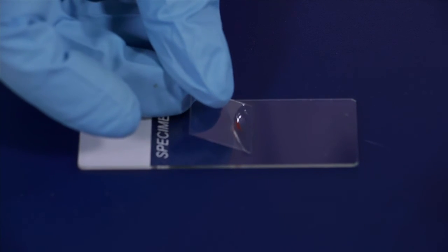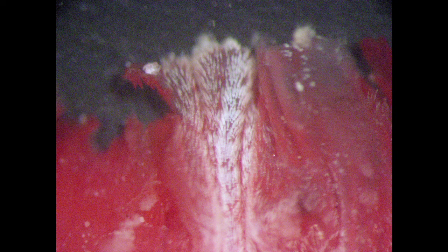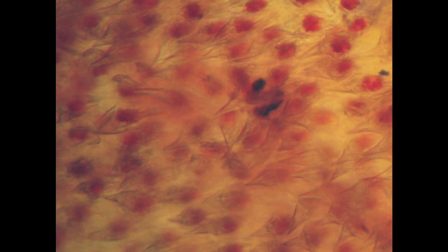Then you put it over the glass and check if the slice is thin enough to see the spines. Some spines inside the Pyura siphons or atrial siphons can be large enough that you can see them under the dissecting microscope. These white lines showing in the picture are the spines. When you see them under the optical microscope they will show like this, and they have some texture on the surface. You can measure their size and note their shape.